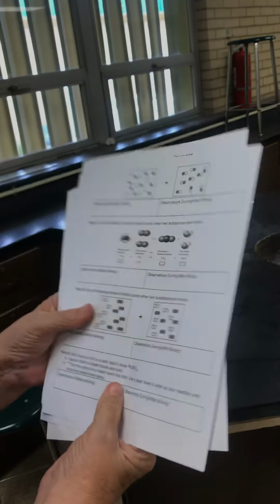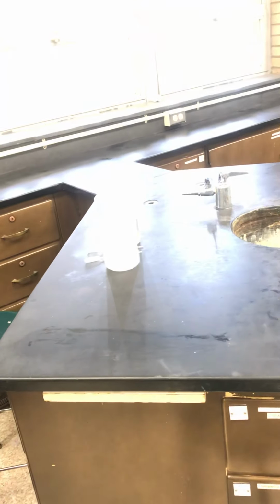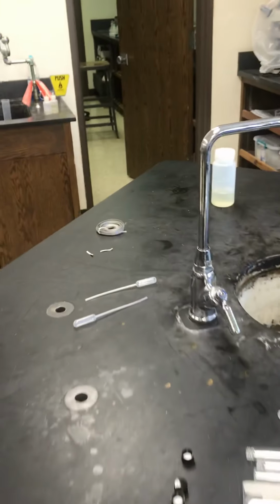Then let's see what we can do with another one. Let's see, where did I put those things? Oh, they're over here too. This one you have to be really careful with because you can't put it down the drain. So far, everything we put down the drain. For the next one, we can.